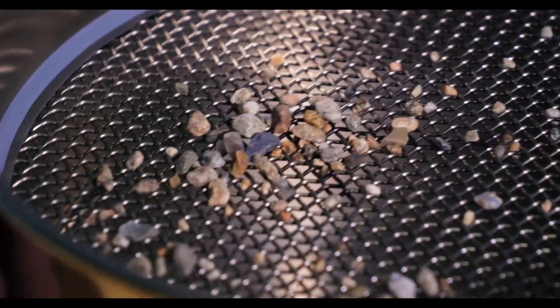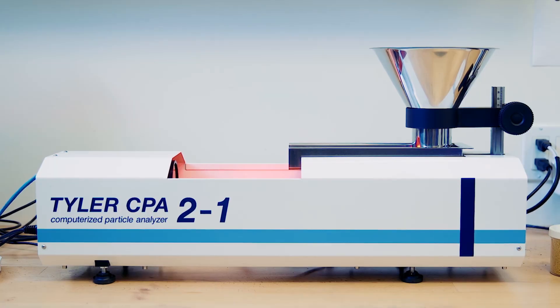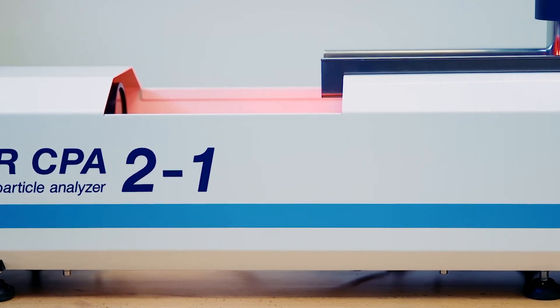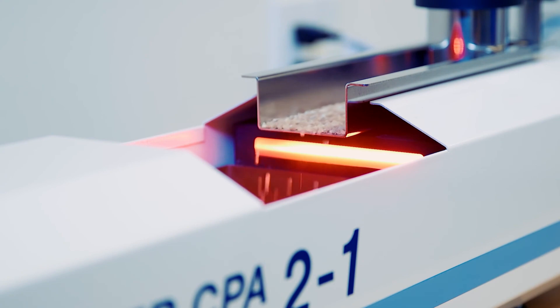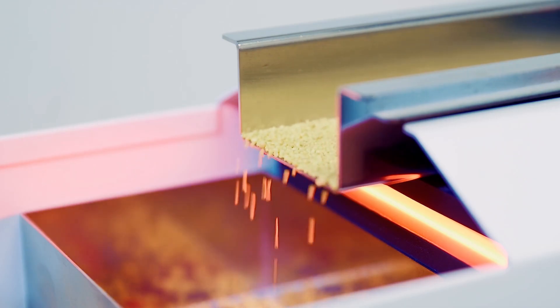The second, and we believe the best option, is to perform the analysis optically using a machine like W.S. Tyler's computerized particle analyzer. This machine simply allows the particles to fall in front of a camera to measure the size of each particle. By following these procedures, you can determine the fastest test time that will get you consistent, repeatable results, which will create the most efficient sieve testing procedure possible.